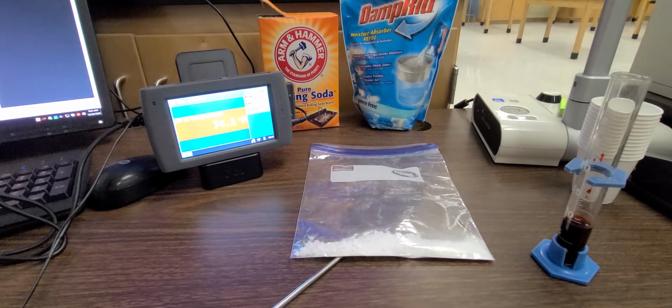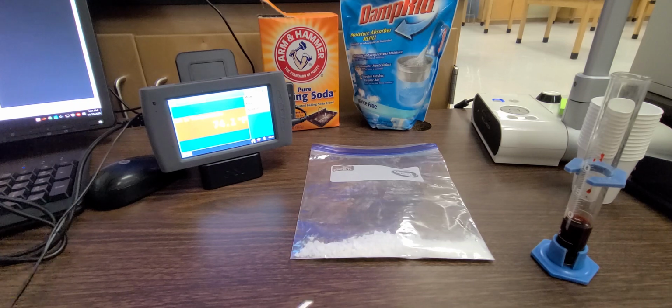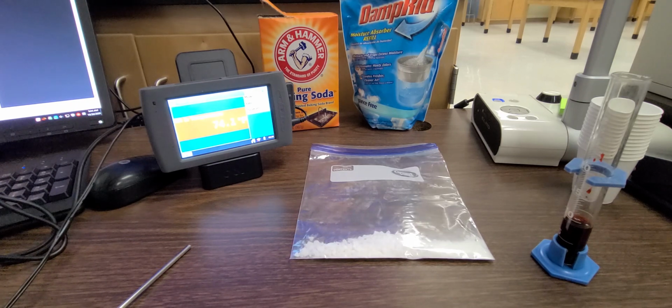Okay, and so when I mix these chemicals together, you're going to start hopefully seeing some evidence that a chemical reaction is occurring. You need to be mindful of watching for those pieces of evidence. And remember, the pieces of evidence that you're looking for are color change, production of gas, any temperature changes if those occurred, and any kind of precipitate formed. Now, we're probably not going to see a precipitate in this experiment because we are not mixing 2 liquids together. Okay, so we've got 2 solids, and then we're mixing in a liquid with those 2 solids.